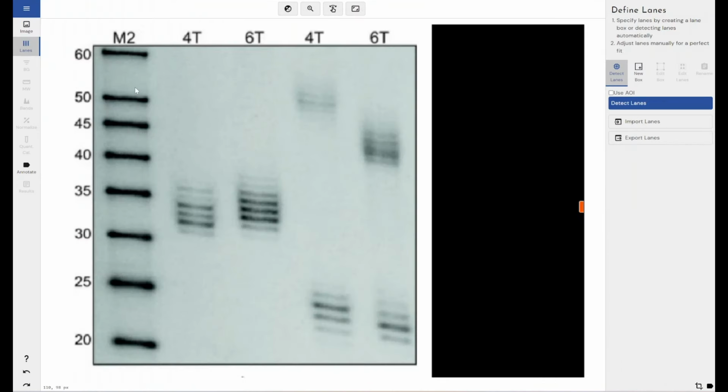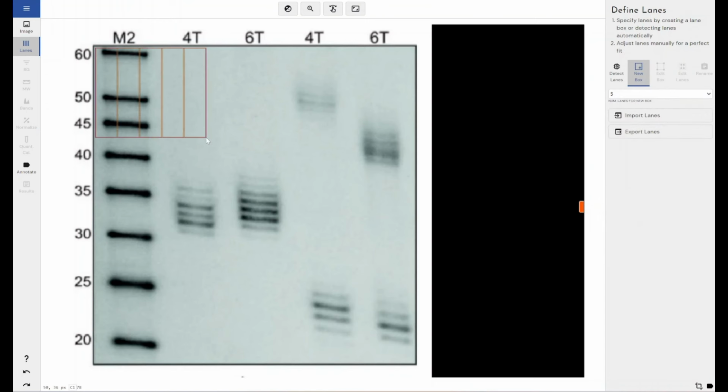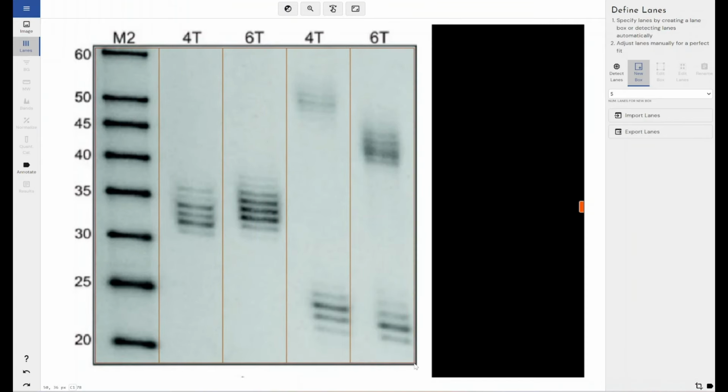So the first thing I need to do is draw in some lanes. Now, the automatic lane detection algorithm is not going to work on this image because we've got a strong border here, we've got these labels, and obviously the software just assumes we'll see a blot or a membrane or a gel rather than seeing text or anything like that. So I'm going to have to do this manually, but Phoretix 1D makes that super easy as well. So first things first, I want to draw a new box in which my lanes will be contained, and I want to draw 5 lanes because there are 5 lanes in this experiment. So if I left click and drag, I create a box with equally sized and equally spaced lanes.